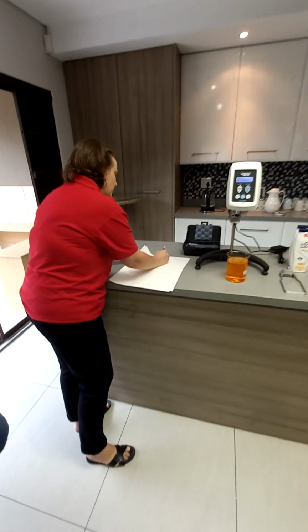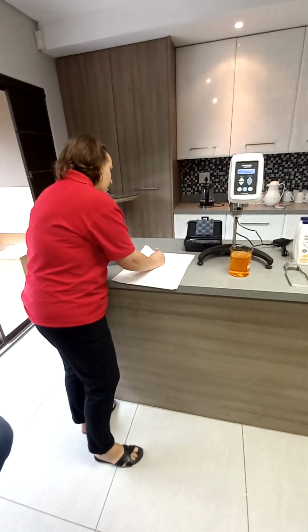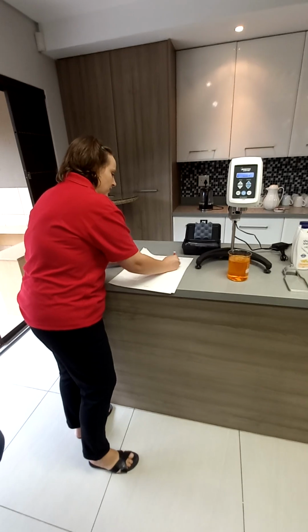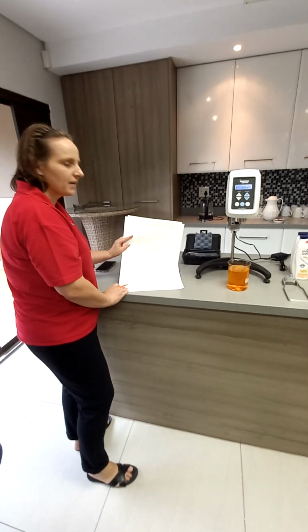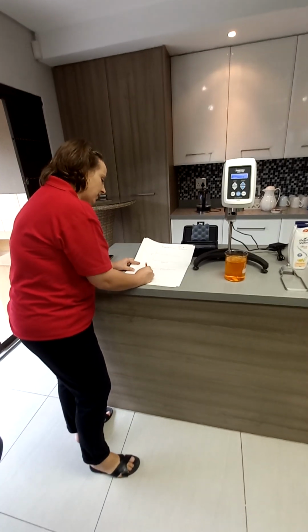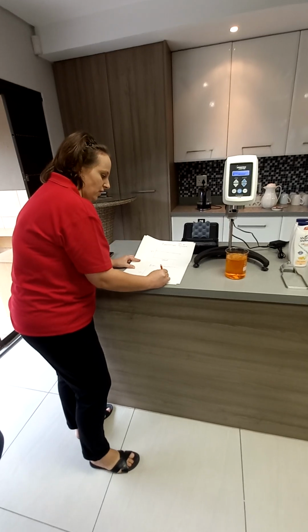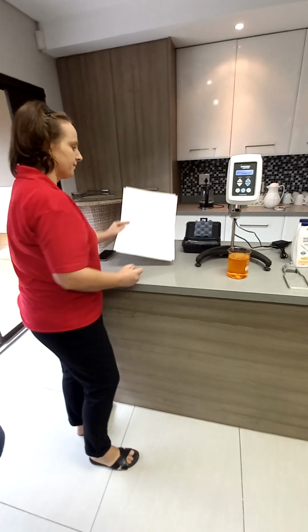If your sample is Newtonian in behavior, it doesn't matter at what speed you test, your viscosity will always remain the same. But most products are non-Newtonian. So as you increase your speed, your viscosity will drop, so you'll have something like this.